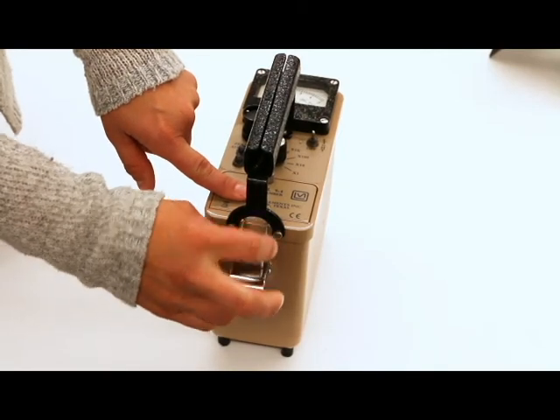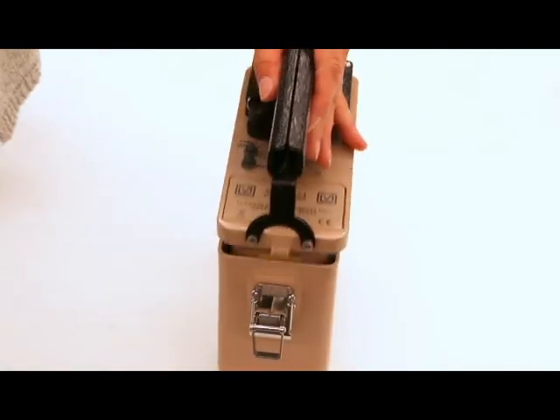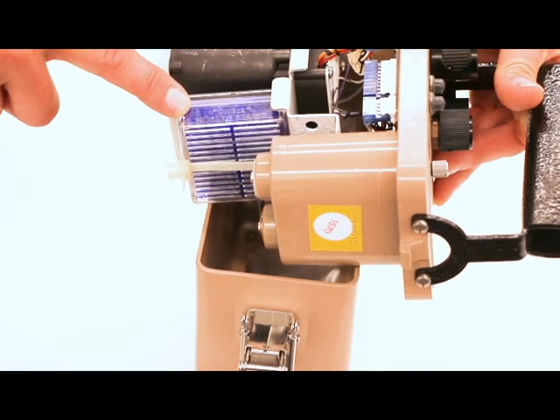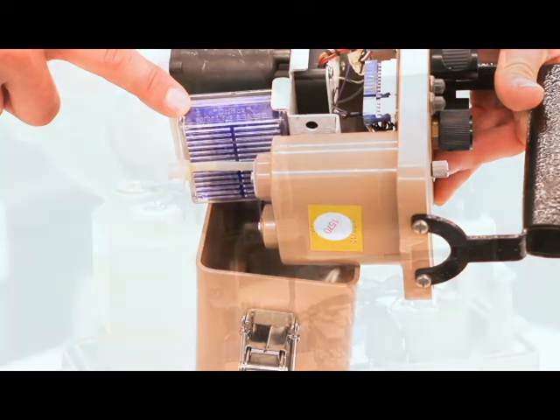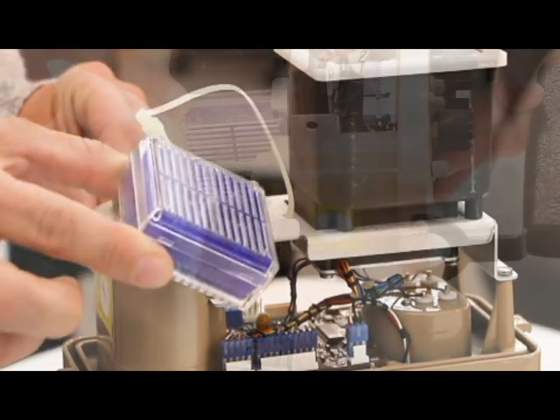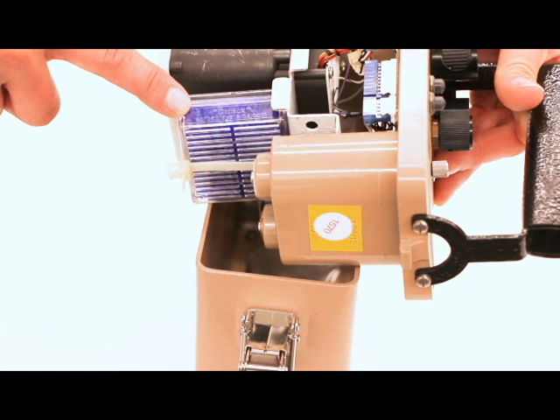Disassemble the chassis by unlocking the latches and pulling it apart. If the desiccant inside the plastic box is blue, it is still good and you can use the instrument. If the desiccant is pink, it needs to be refreshed or replaced. The restraining strap may be released by pressing the center tab toward the strap, thus releasing the desiccant box. A desiccant that has turned pink may be recycled by placing it in an oven at around 130 degrees Fahrenheit for two hours, or in a microwave on the high setting for 10 seconds. If condensed water is apparent, wipe off the water and heat for another 10 seconds. Repeat until the box and desiccant appear dry and the desiccant is blue.